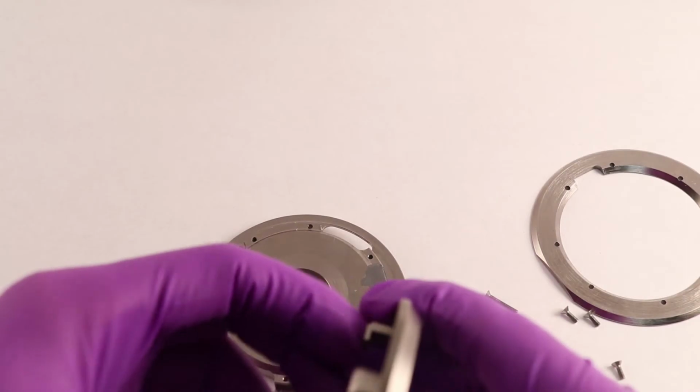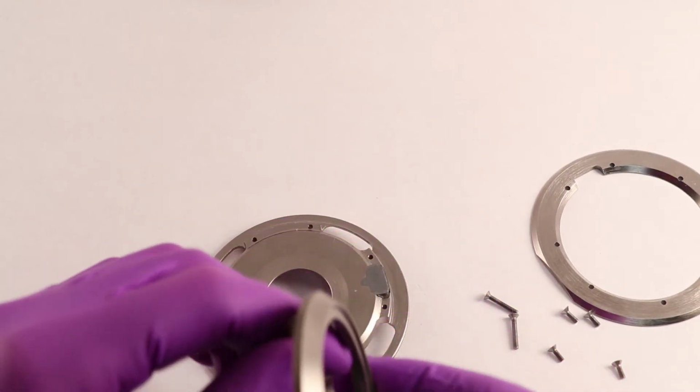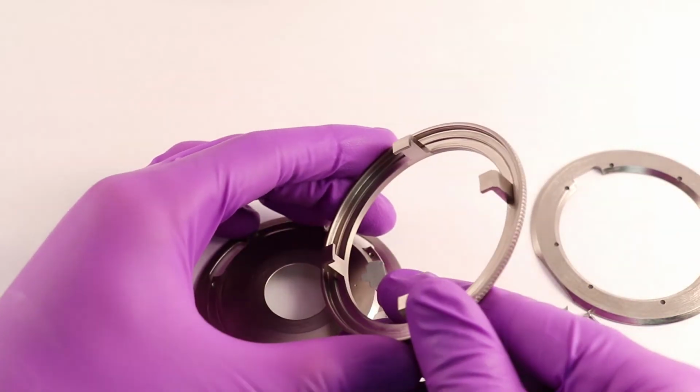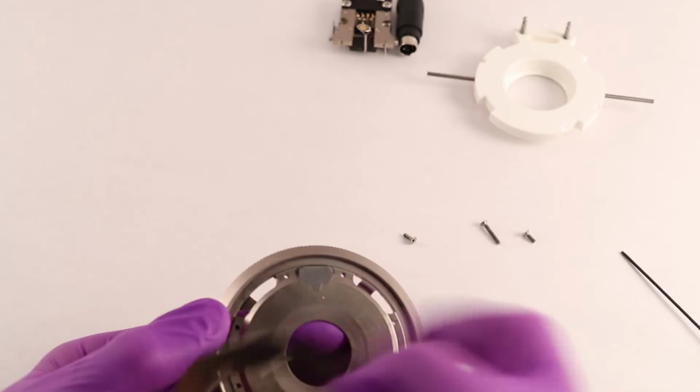Rotate the knurled ring and 4-paw ring so the 4-paw ring is centrally located in the threads of the knurled ring. This will be exactly in the middle of the travel of the chamber. Now reassemble.